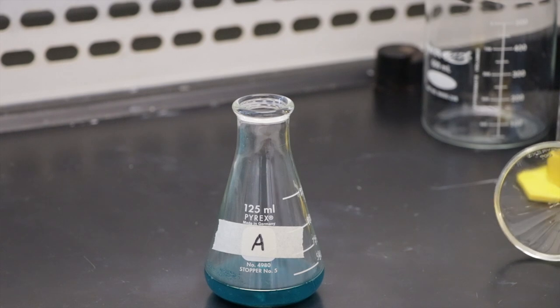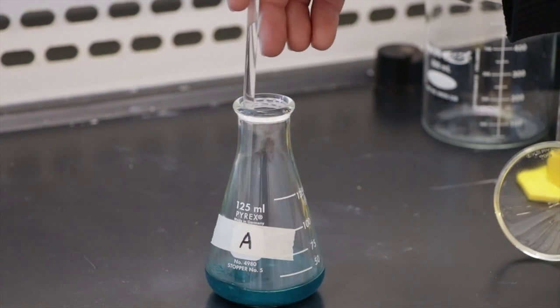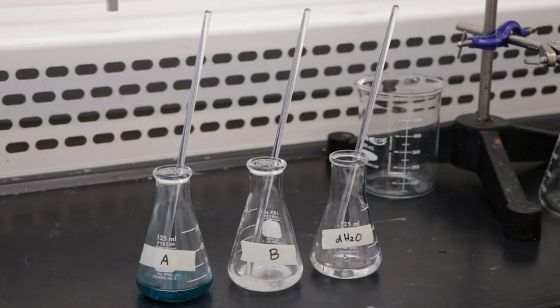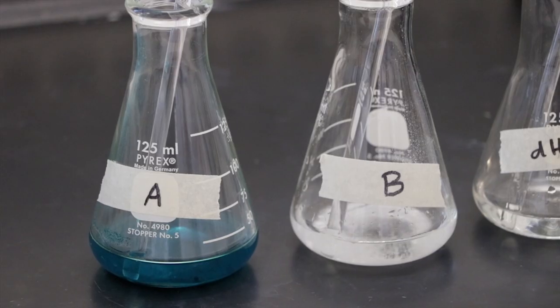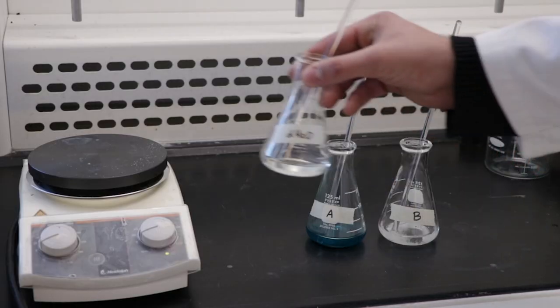Repeat this process to accurately weigh by difference 1.4 grams of glycine into the Erlenmeyer flask labeled B and add 20 mL of distilled water into it. Obtain a third Erlenmeyer flask and add about 20 mL of distilled water to it.